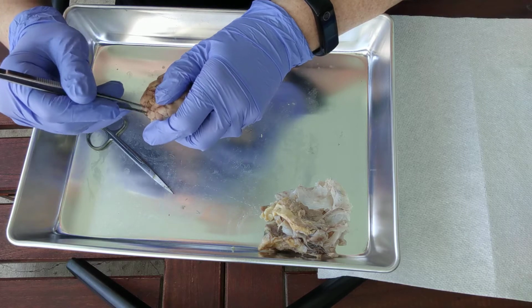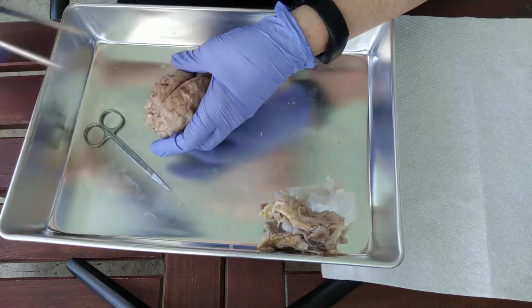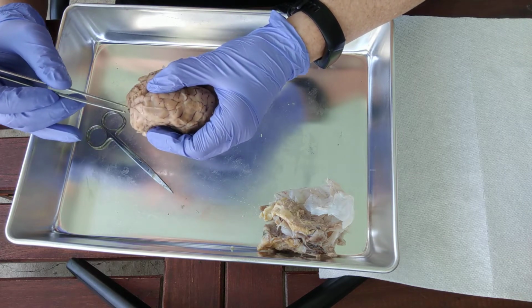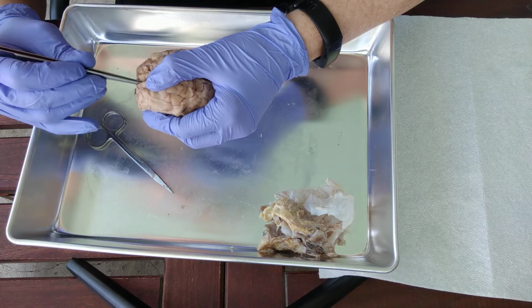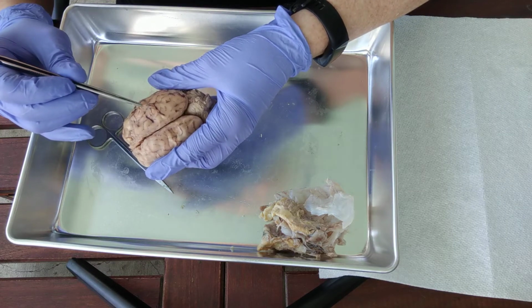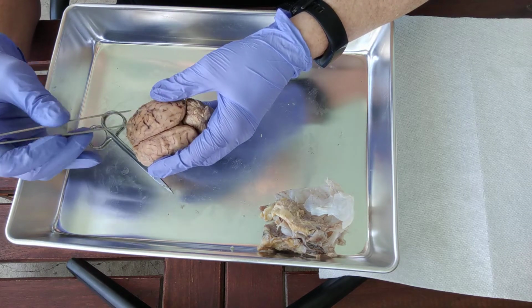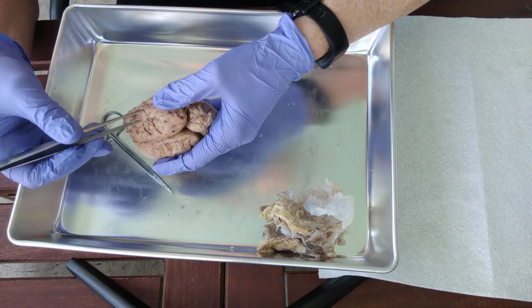Okay. So let's go over the meninges. Here's the dura mater. And then the arachnoid matter is going to be mostly removed, so we won't really see it on your specimen. But you can see the pia mater. Where is pia mater usually found? Pia mater is going to be on the organ itself, right? So this right here that I'm gently tugging on, that's the very delicate outer layer around the brain itself. So that is the pia mater. Here's some pia mater.